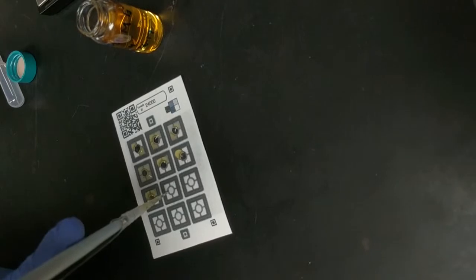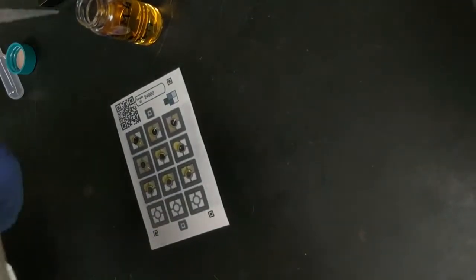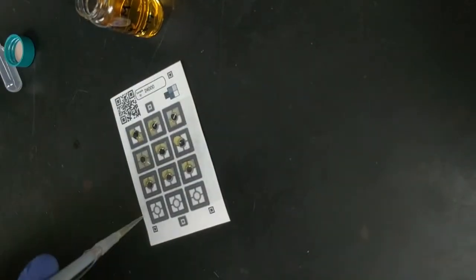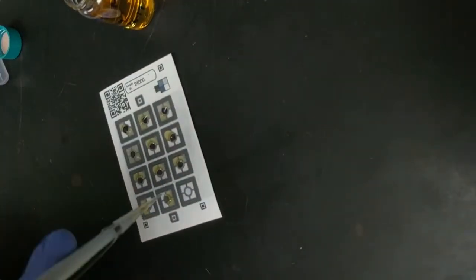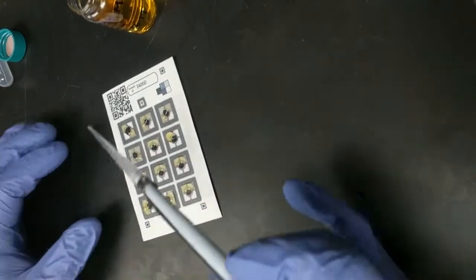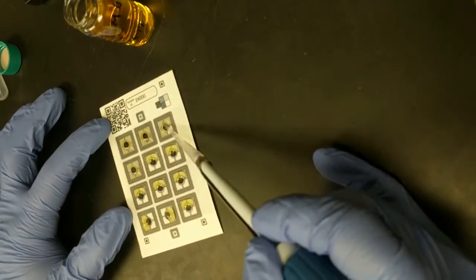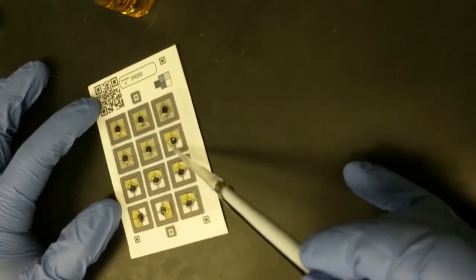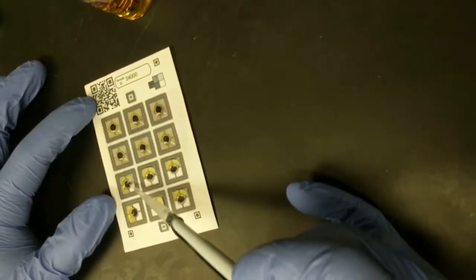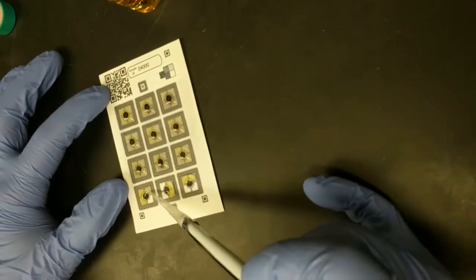You will notice that the test solution flows over the thin lines of each of these squares, but is being contained by the thick outer black square. Each of the subdivisions within each square contains a reagent that is necessary to do the analysis. So you have to go back through and make sure the test solution flows over all of these individual subsets of the squares. Start at the top left and work your way down to the bottom right to minimize the contamination between the separate reaction areas.